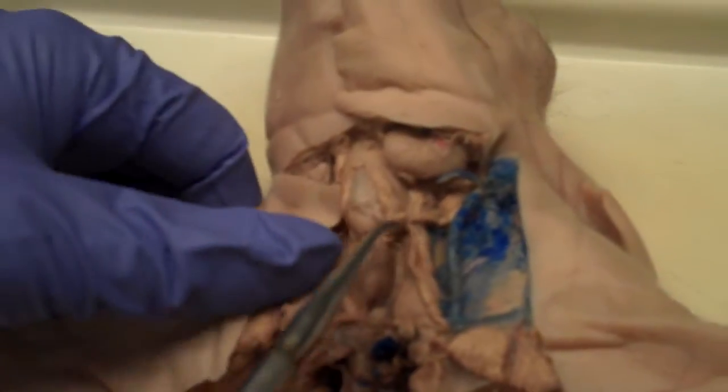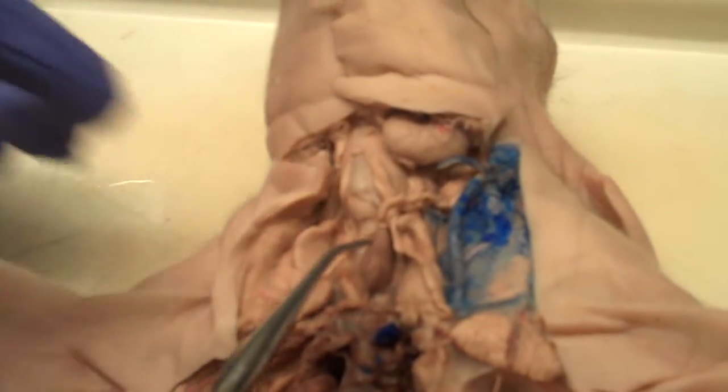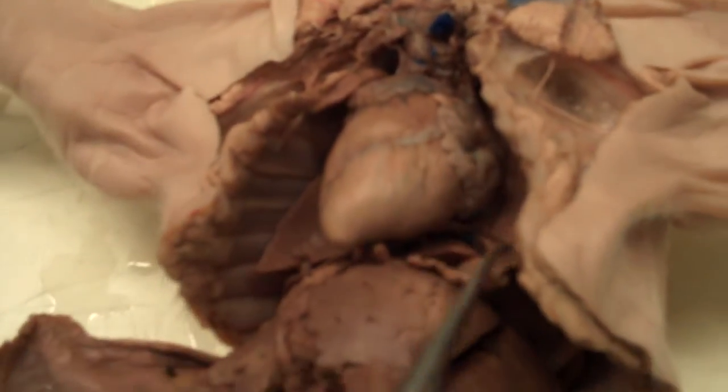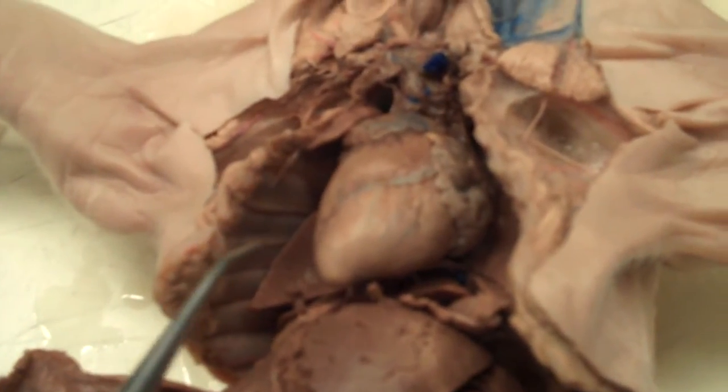This is figure 3-7, ventral view of thorax and peritoneal cavity. We have the larynx, then we have the thymus, the thyroid, then we have the pleural cavities — the left pleural cavity and the right pleural cavity.